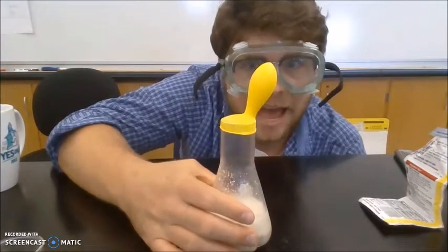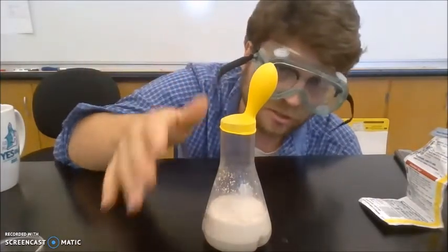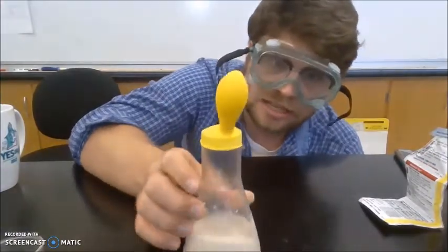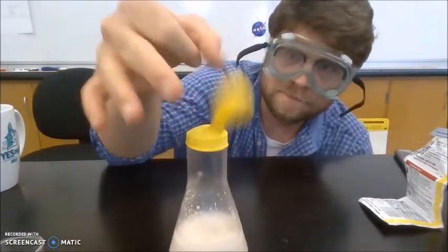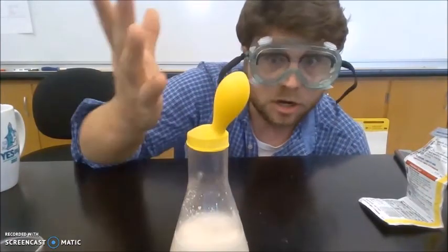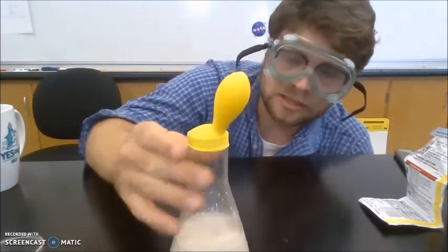I've let 2 minutes pass. I paused it. You don't need to stare at a screen for 2 minutes looking at a balloon rise. But you can see, I'll note a couple things. The balloon, it's got some air in it. It's like a little mini punching bag. That's carbon dioxide gas being produced by the yeast.